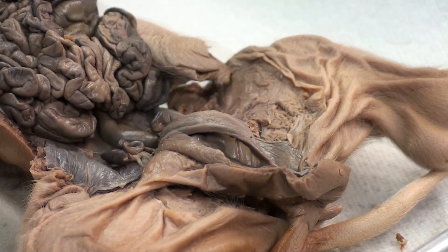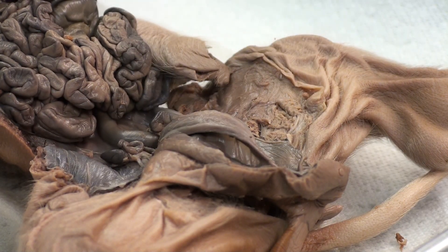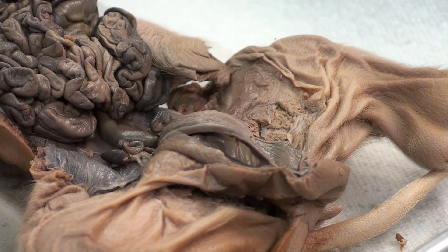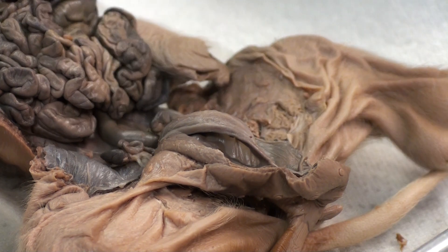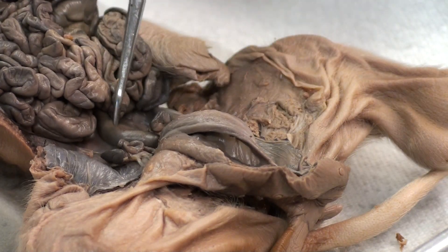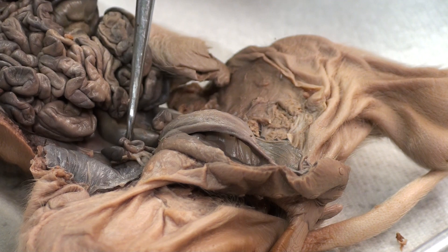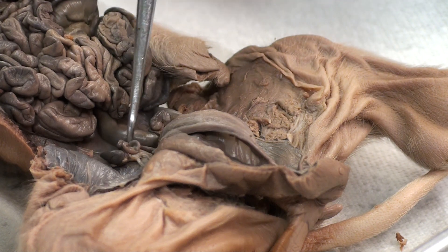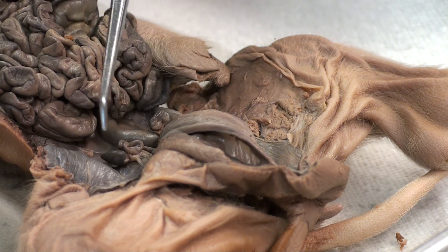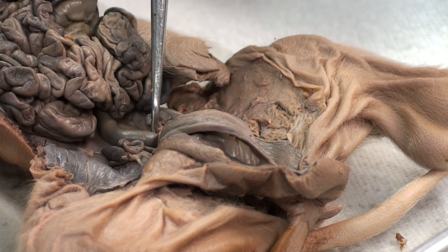We'll be talking about some organs and systems down here. Right here is the rectum, and on either side of the rectum, as you can see, these are the ovaries — ovary one and ovary two.